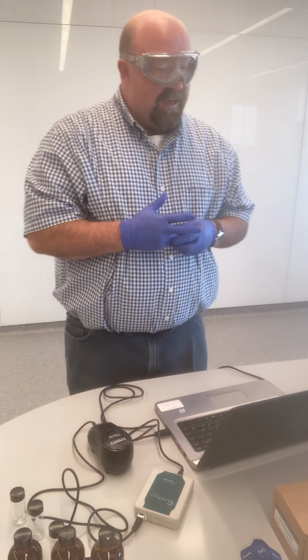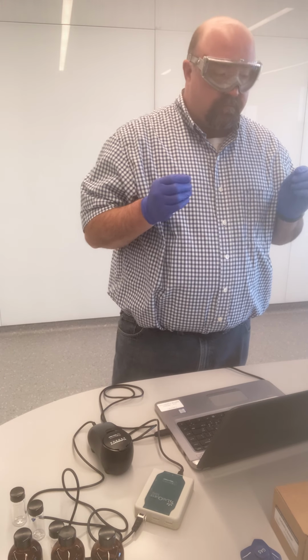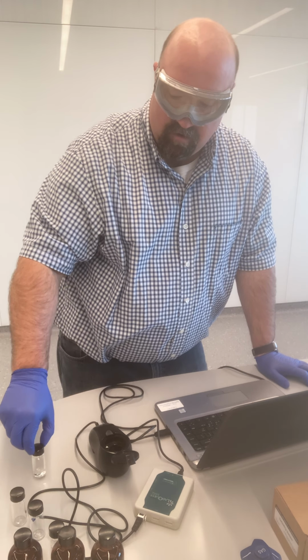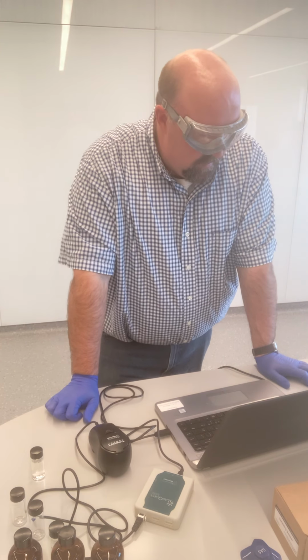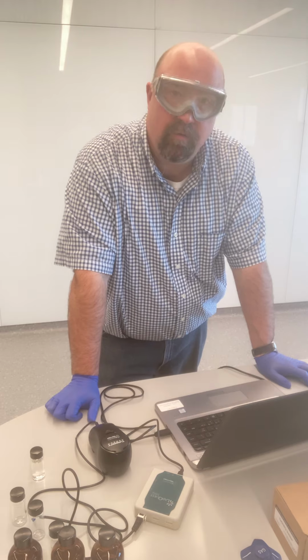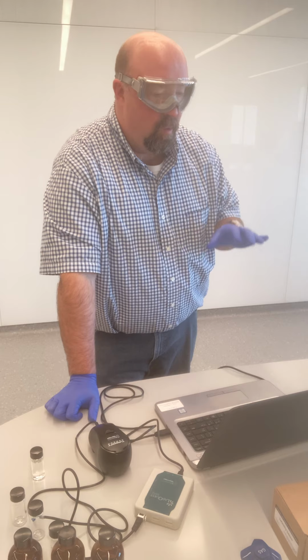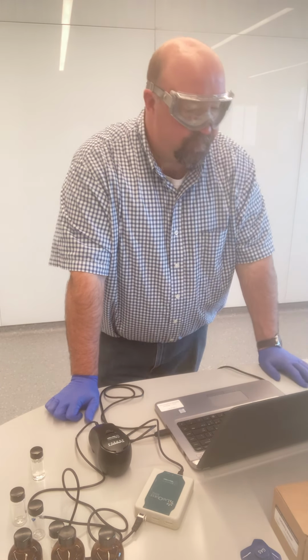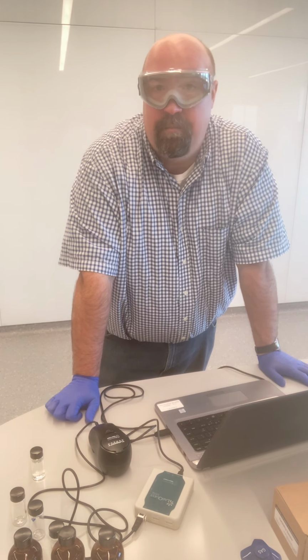It's always a good idea after you calibrate an instrument like this, just to make sure that it is reading accurately. And so right now my 0 turbidity standard is in there. I'm just going to pop the 100 back in. And I see that it is reading 100.6 NTUs. Perfect. I mean, no, it's not dead on 100, but turbidity's one of those things, since we're looking at cloudiness, we do expect a bit of fluctuation in our data. And so 100.6, it's actually now reading 100.2. It's pretty much spot on.